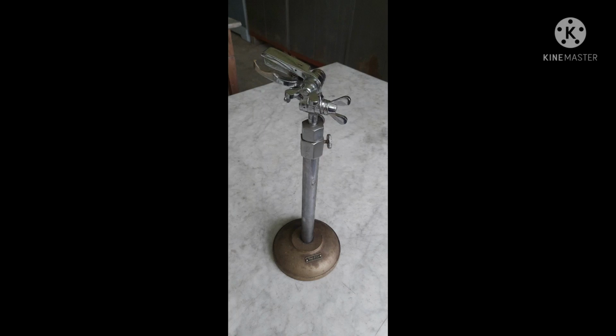Unlike long bones, skulls have their own peculiar shape, and there is an essential need for their exact orientation. For this purpose, a special instrument called craniophore is used. It consists of a pair of jaws designed to be attached at the occipital foramen, one which remains on the outside and the other within the foramen.